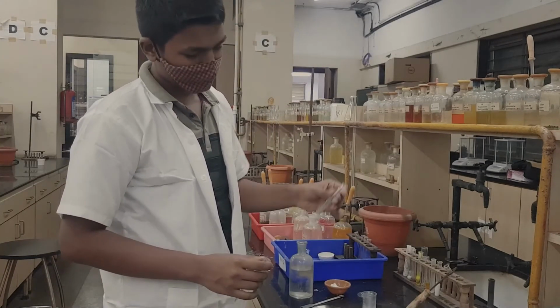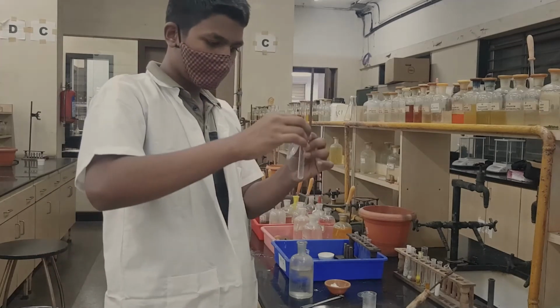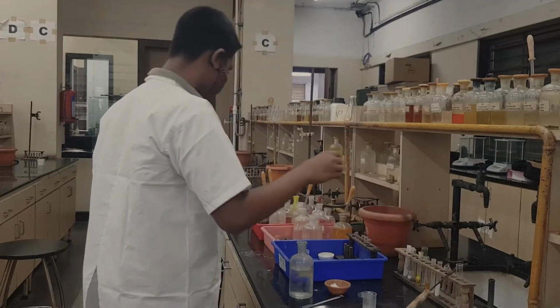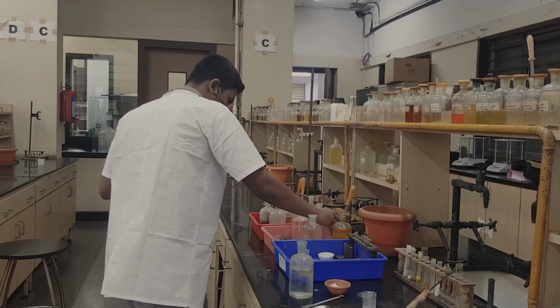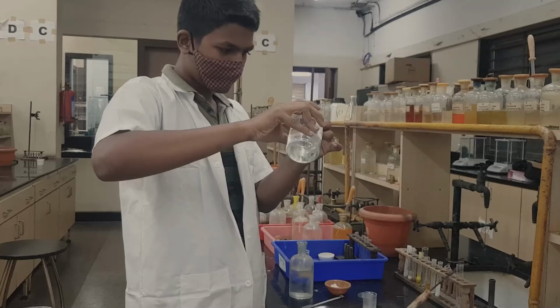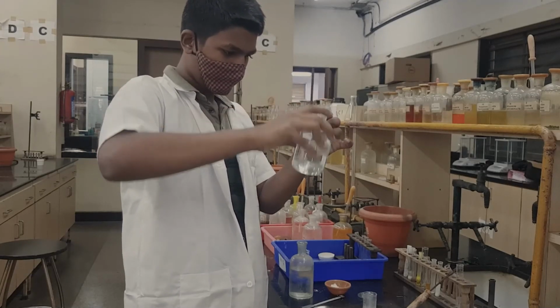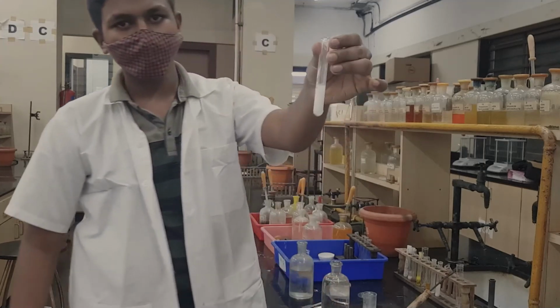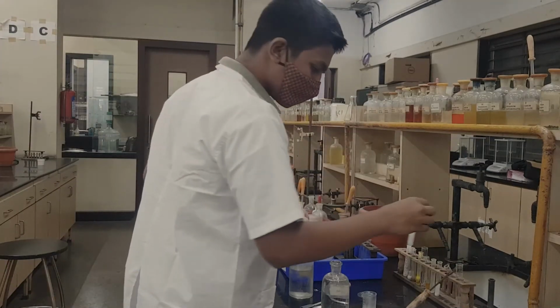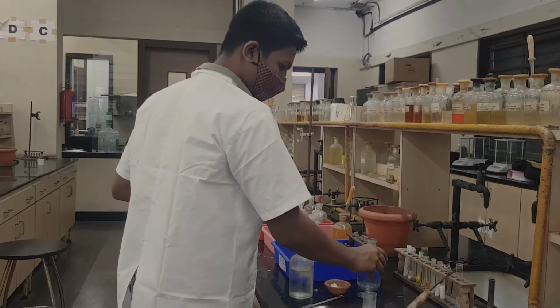We have two confirmatory tests, out of which the first one is with TS. To the TS we add dilute sulfuric acid, and we are predicting a white PPT because we have seen strontium present, and yes, we got white PPT. So here we see white PPT, so strontium is confirmed. But we still continue with one more CT to check whether strontium is confirmed.